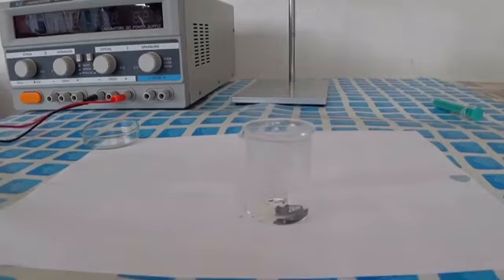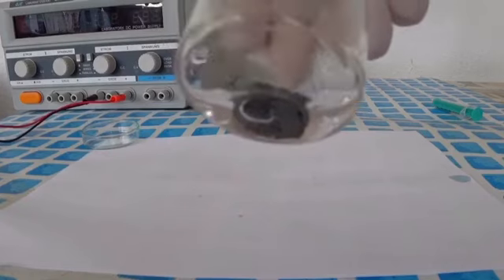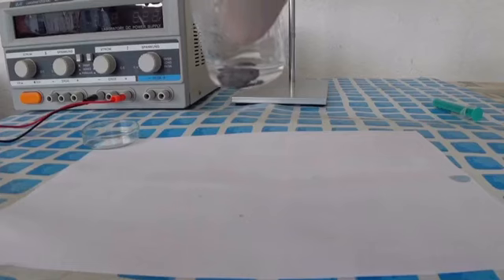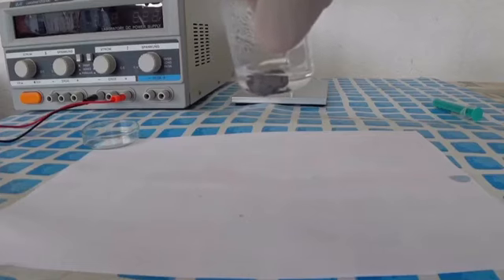I had to heat it up for a while to get a decent amount into solution. You can see it clumped up on the bottom, but I think this solution here should do the trick of growing crystals really well. So let's begin.